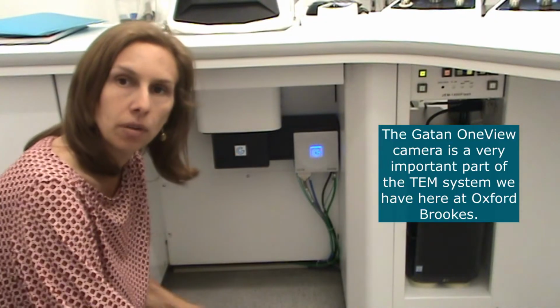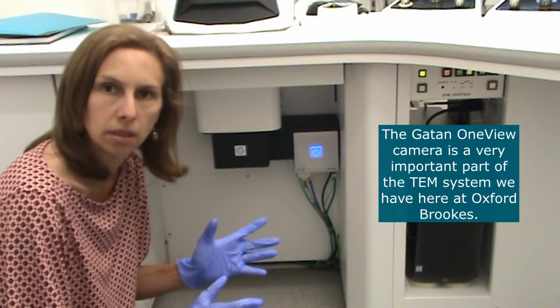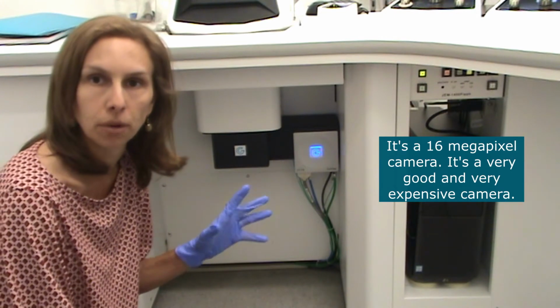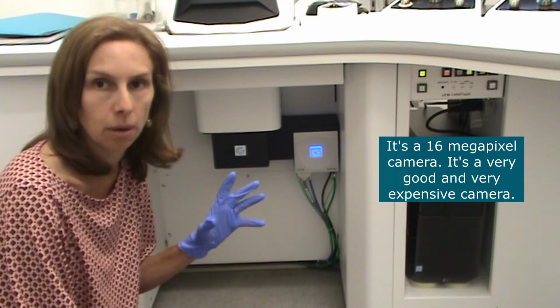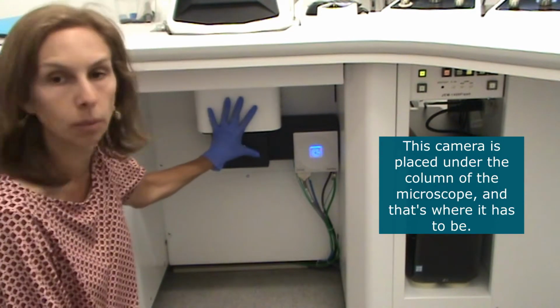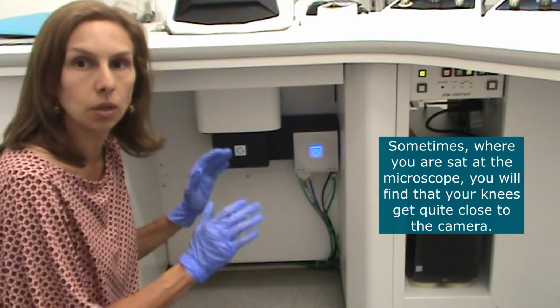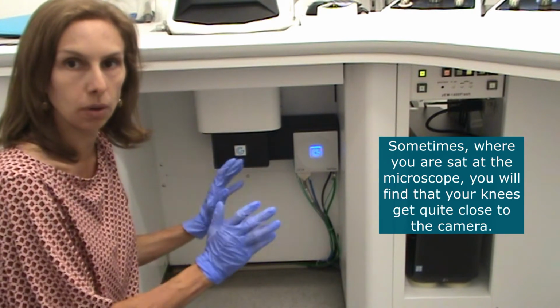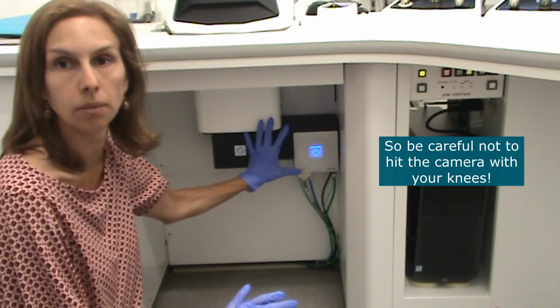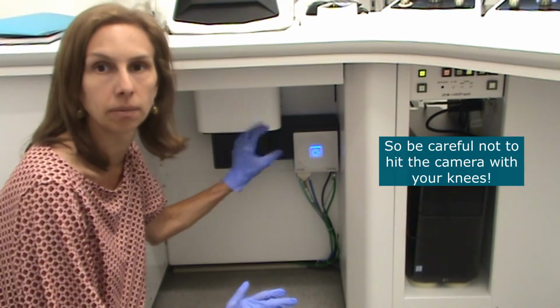The GATAN OneView camera is a very important part of the TEM system we've got here at Oxford Brookes. It's a 16 megapixel camera. It's a very expensive and very good camera. This camera is placed under the column of the microscope, and that's where it has to be. Sometimes when you're sat at the microscope, you may find that your knees will get quite close to the camera, so beware of not hitting the camera with your knees.